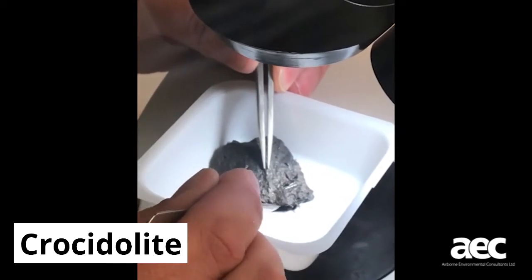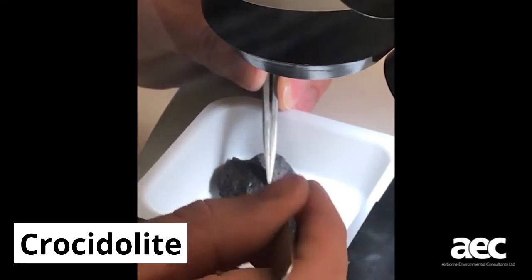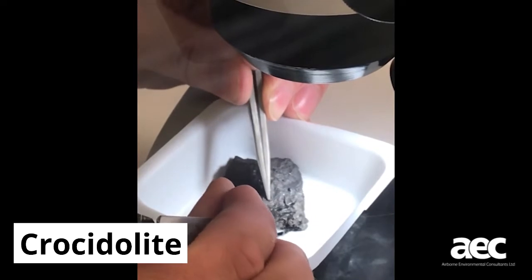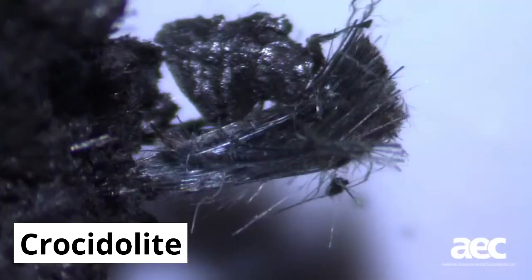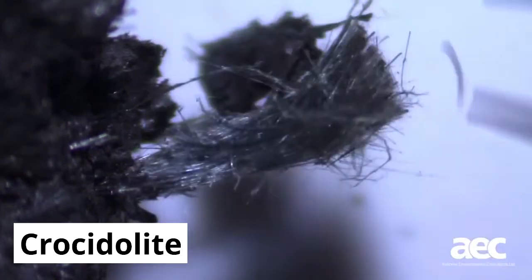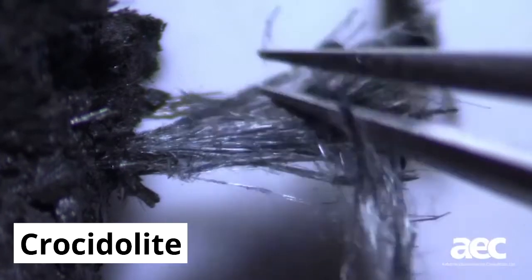This sample is of bakelite plastic, used historically to form products such as toilet cisterns, telephones, and door handles. First, the sample is prepared, and then, in a controlled environment, the sample is reviewed under the stereo binocular microscope in search of suspect fibres. Here you can see fibres that are blue in colour, with a straight appearance and a paintbrush-style end to it. These initial observations would suggest this is crocidolite.